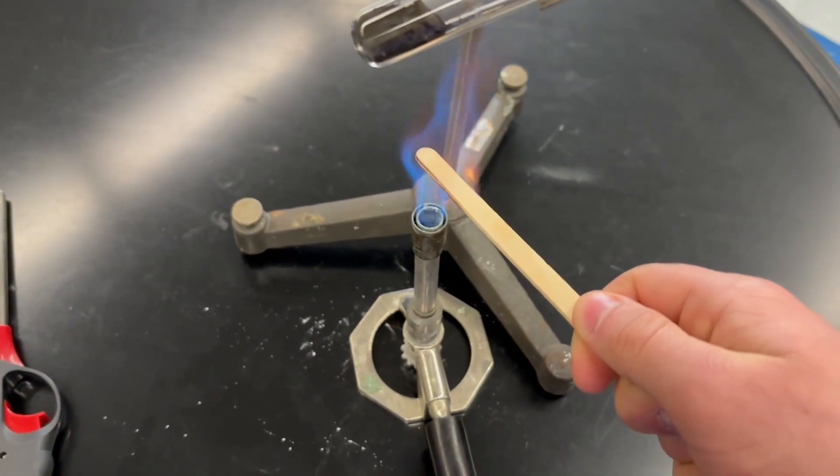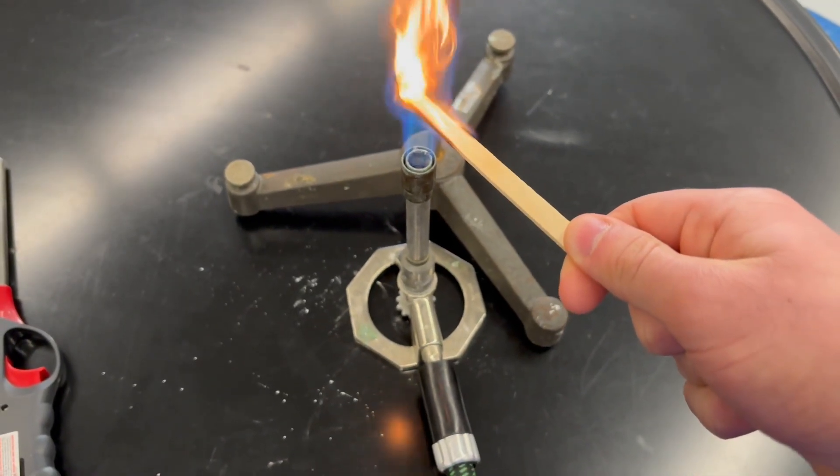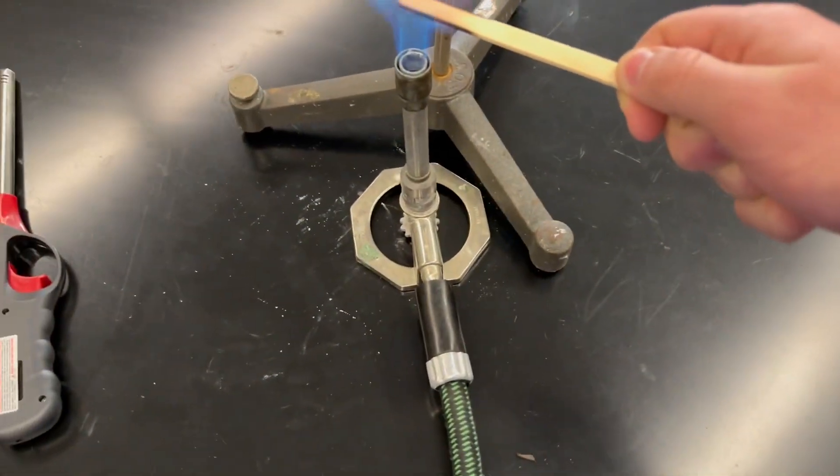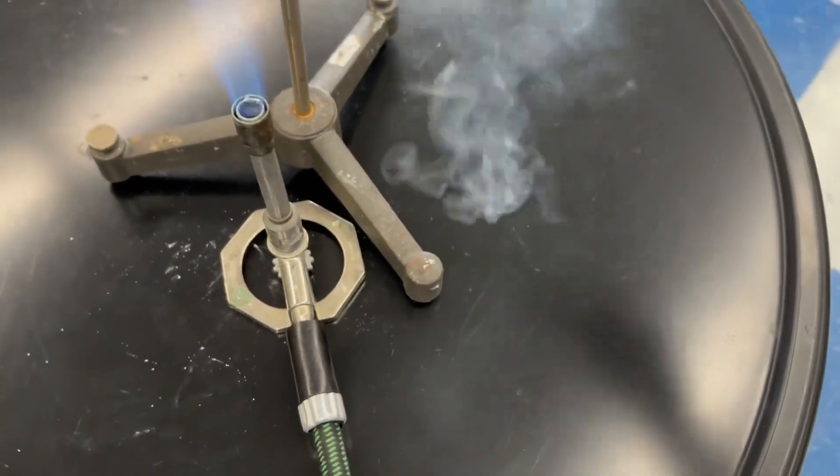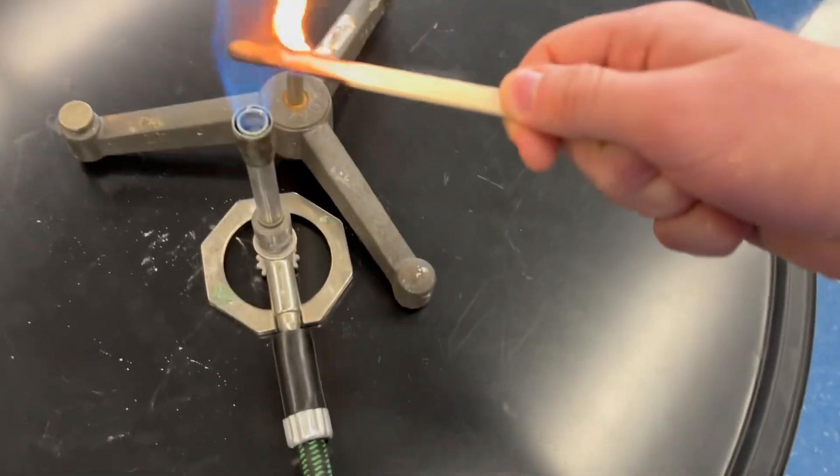Apparently it should go low, that's all.